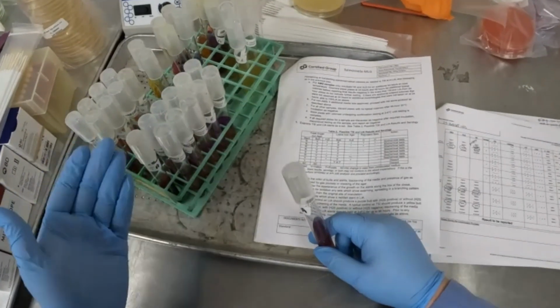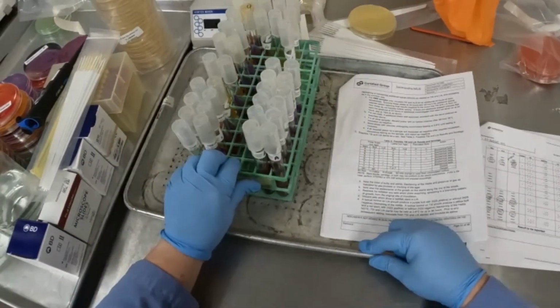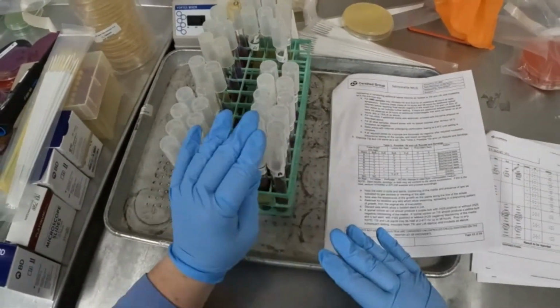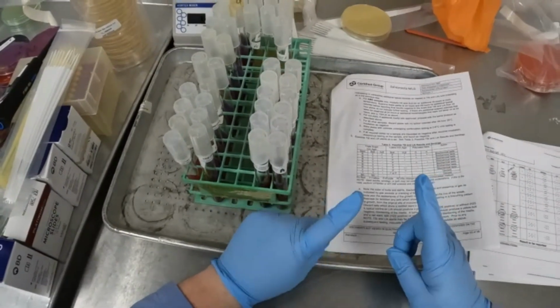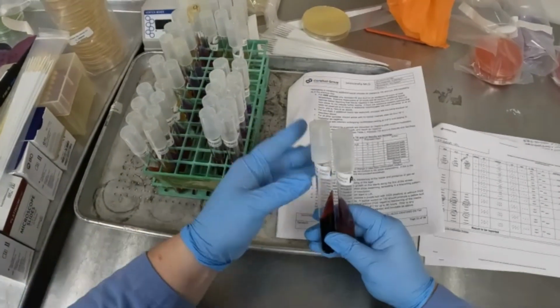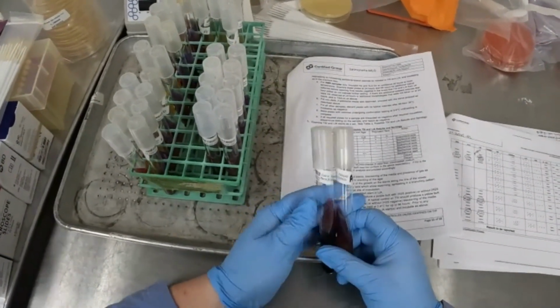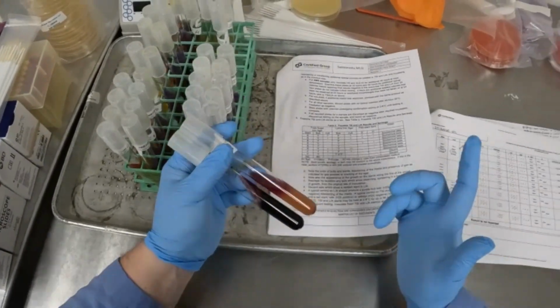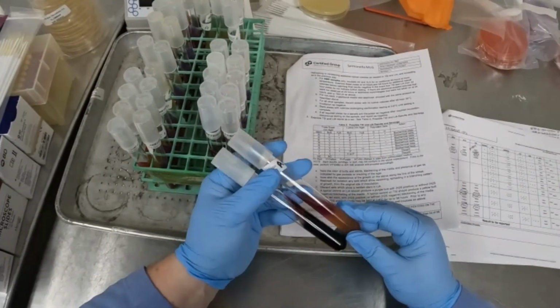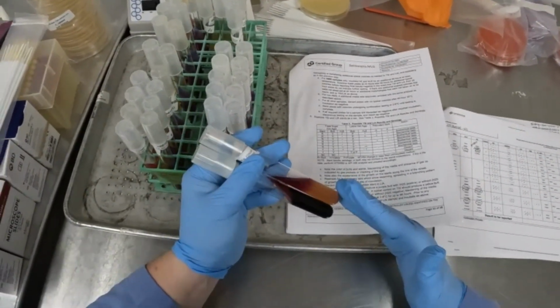Now when we look at our slants, we're looking at them as a set, because remember when we struck from our colony, our selective agar plates to our slants, we used one colony for both slants. And that's important because within this set of slants that we use to streak our colony, we have six separate reactions, but we're going to have 4 different items that we're going to record, and then we're also going to record whether or not we see any H2S production.